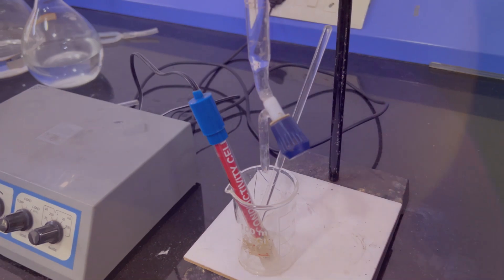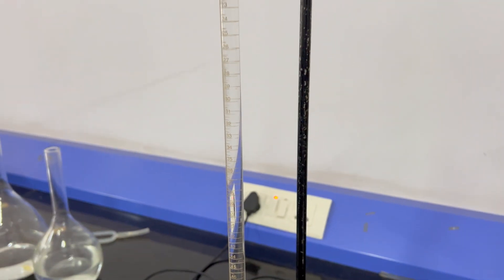Today we are going to see one instrument in electrochemistry — that is conductometry titration. In conductometry titration, we know the mobility of the H⁺ ion and the OH⁻ ion changes when one ion is replaced by another ion. The conductometric graph for strong acid versus strong base shows how it is decreasing fast and then increasing.